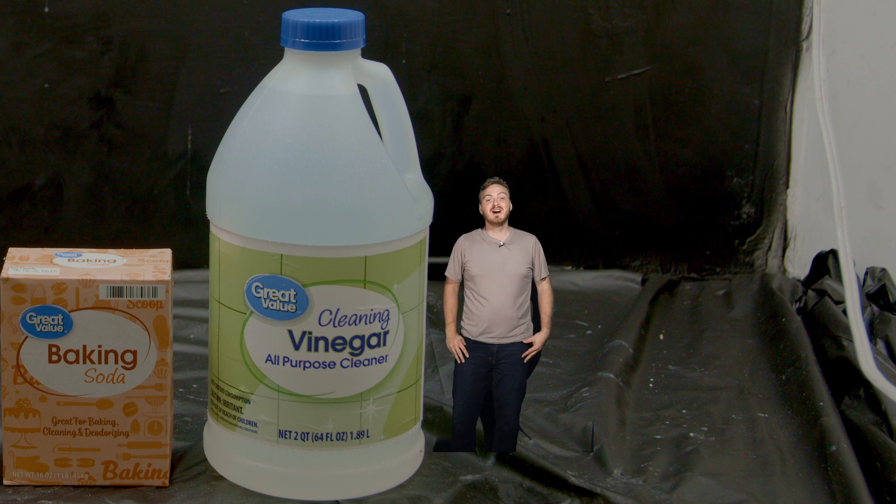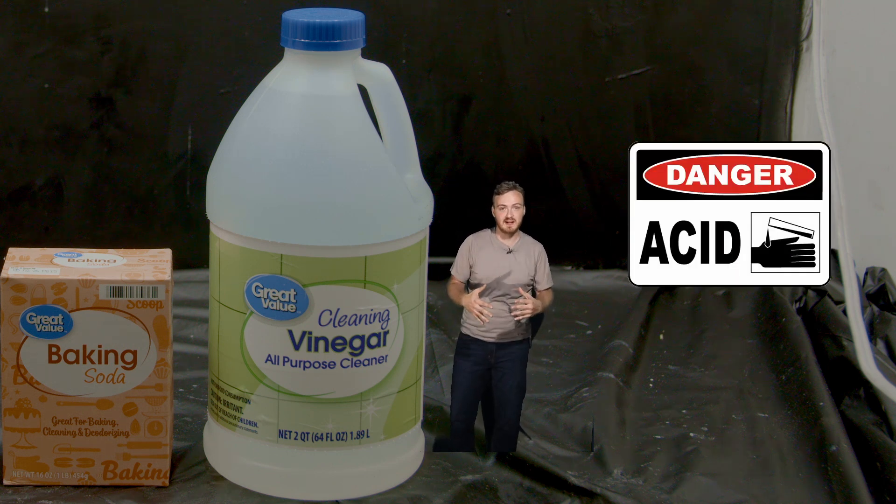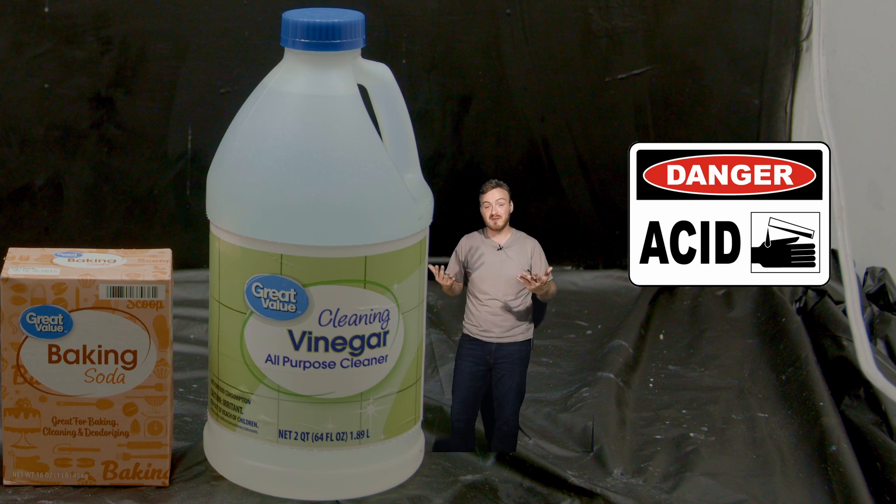Hello. Today we're going to be concentrating vinegar into almost pure glacial acetic acid with stuff that I found from Walmart.